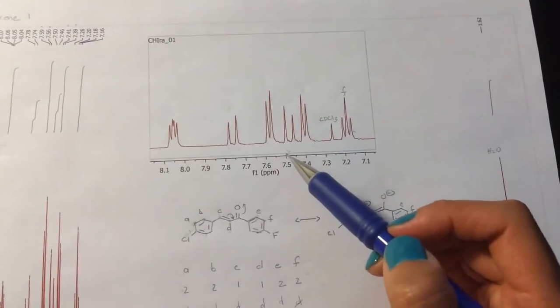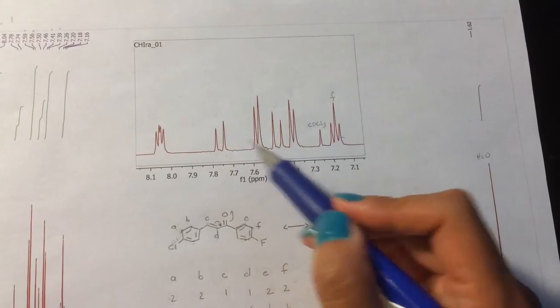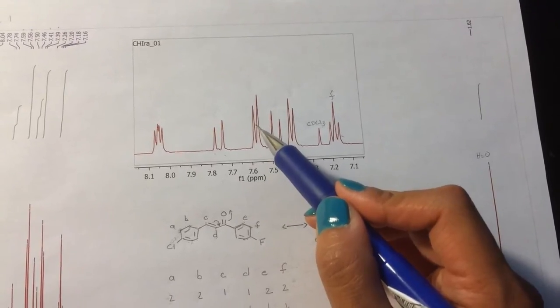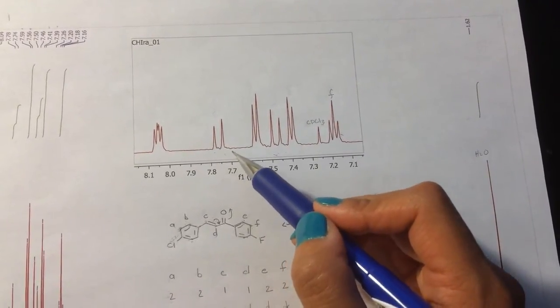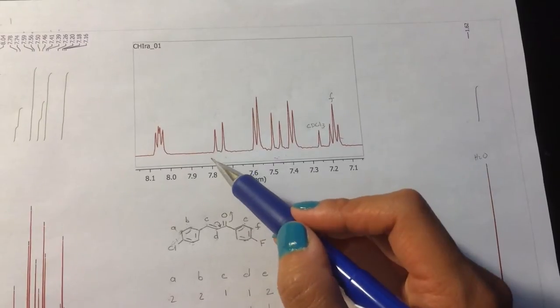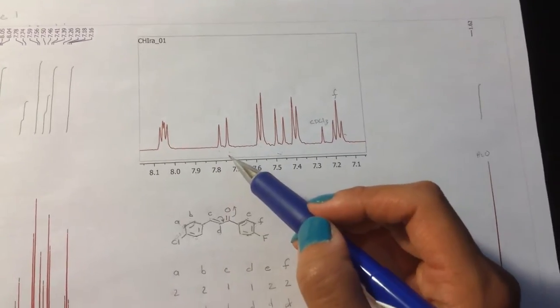And something that I want to point out is that these 2 peaks look alike, and what I mean by that is that the spaces between the peaks are similar, and the spaces between here are larger than, say, this peak that's here. And this is actually so far apart that some of you might have even integrated these as singlets, but if you did that, you would see that these probably integrated to 1/2. And since you can't have half a proton, they belong together and they're actually a doublet.